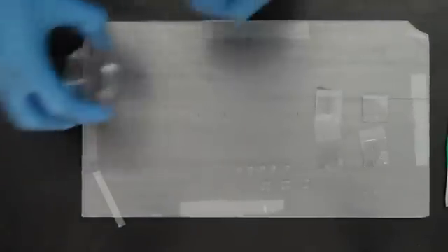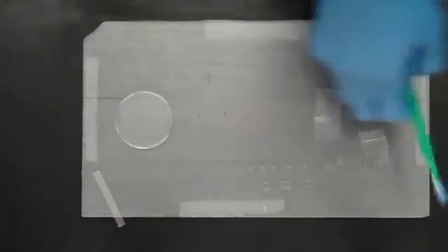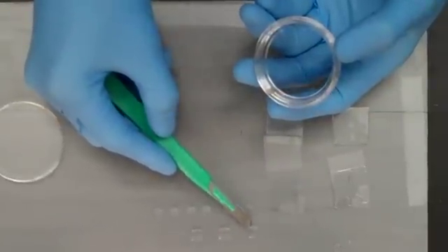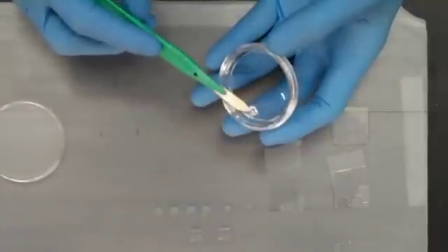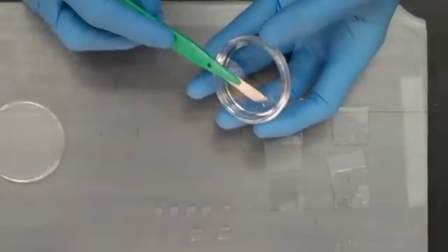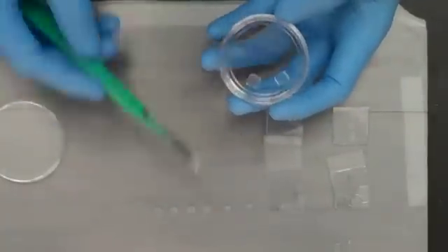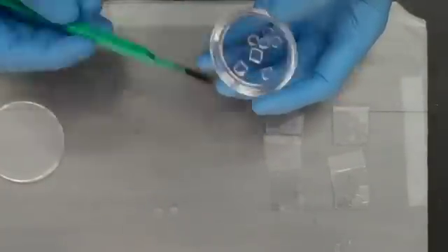After the pads have dried, transfer the pads to your imaging surface to prevent pad evaporation.